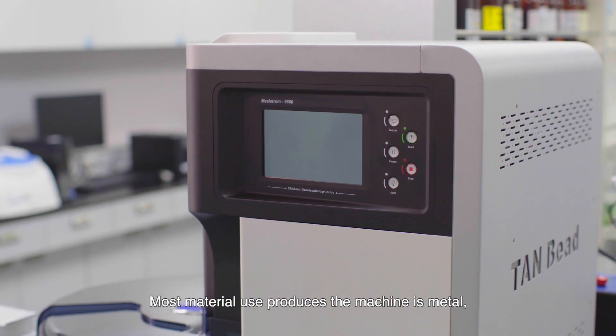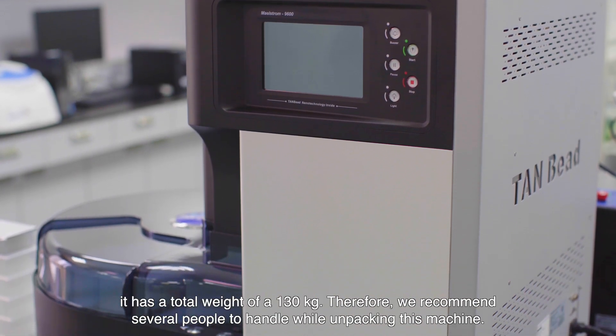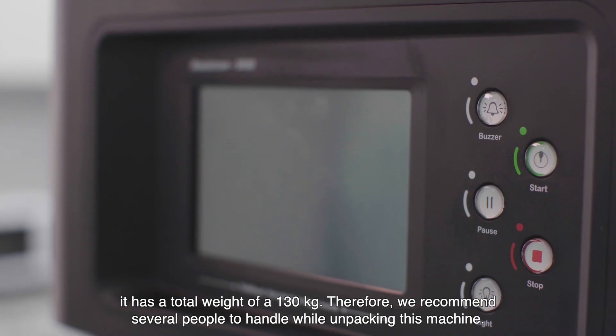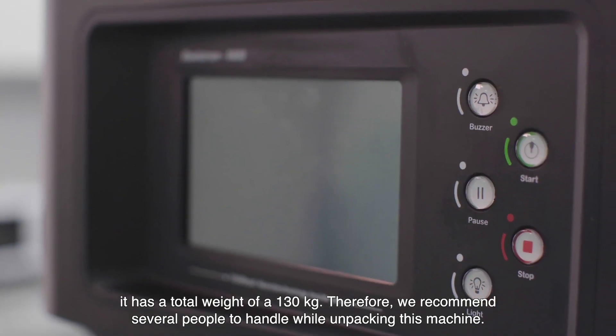Most material used to produce this machine is metal. It has a total weight of 130 kilograms, therefore we recommend several people to handle while unpacking this machine.